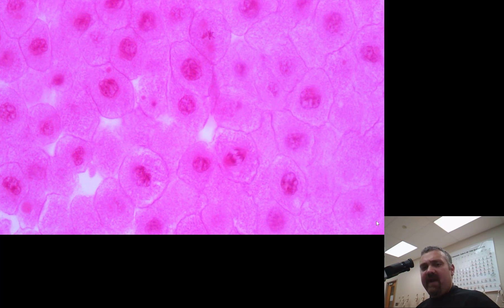We'll go ahead and go to the oil immersion just for the practice, but you can actually see the different stages here already. It's going to go dark. As I move the objective halfway, I'm putting the single drop of immersion oil right on the center of the slide. Look for my other videos on why we use immersion oil and how microscopes work.